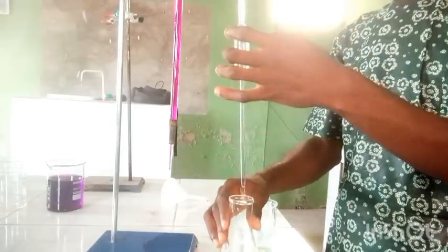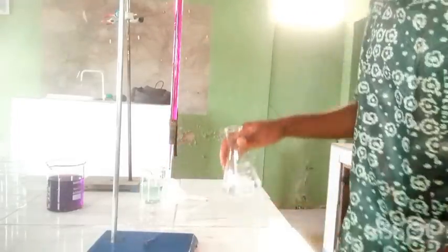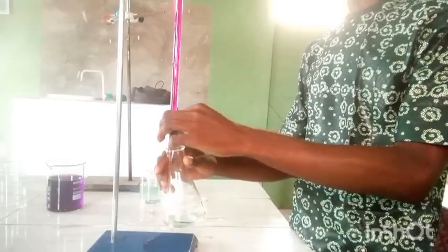The reason why an indicator is not needed is because the solution — KMnO4 — has its own colour, and that colour changes once the reaction occurs. So KMnO4 acts as a self-indicator.